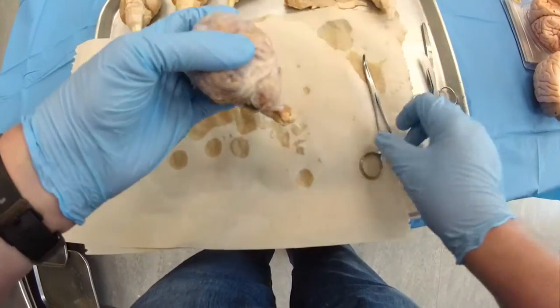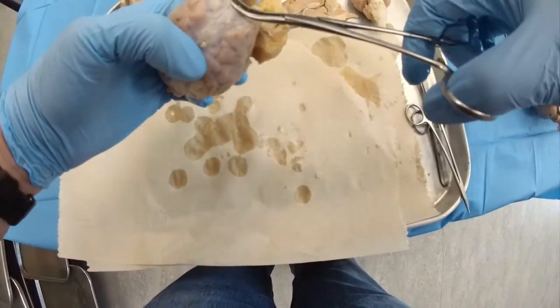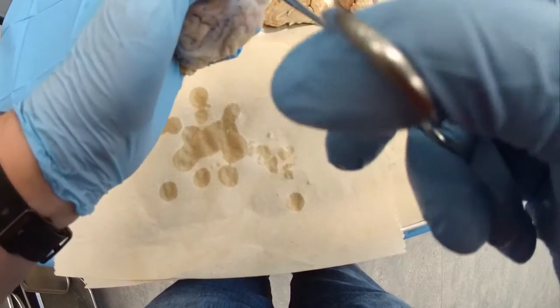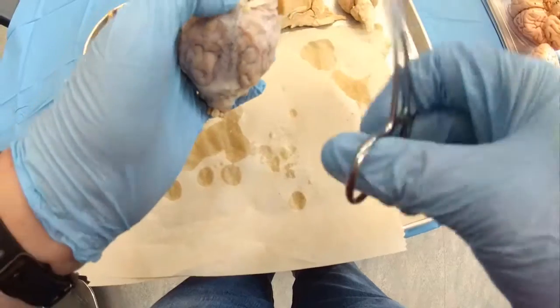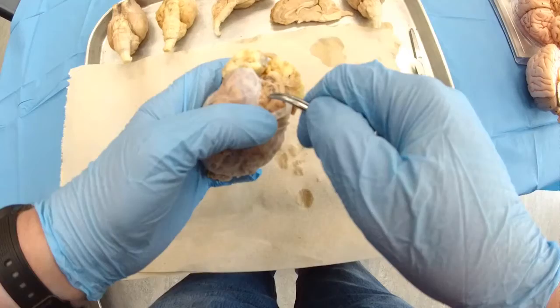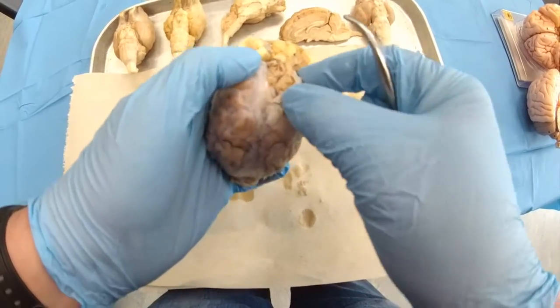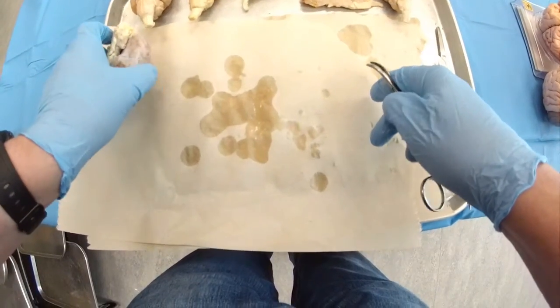So first exercise, first step, we will need to remove the dura mater, and you can see that it's not really so hard. It's quite soft. Then the next layer is going to be the arachnoid, which resembles a kind of spider web. So you can see it. And tightly attached to the cerebral cortex will be the pia mater.